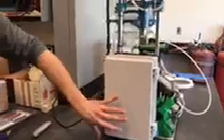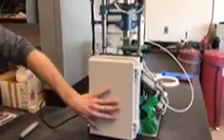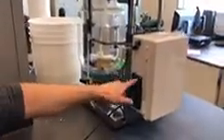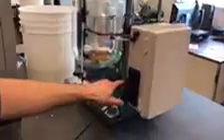Here in the box we have the controls where everything will get into inside. Everything is controlled inside of here, taking the inputs from our data logger and our probes and then outputting it through this panel back here. We will make the label here soon. So this would be our agitator. This is our pH pumps for the acid and the base. This is for our influent pump, and this is for our effluent pump.